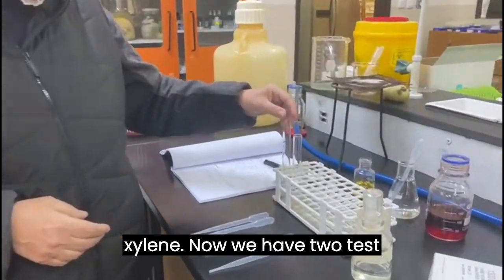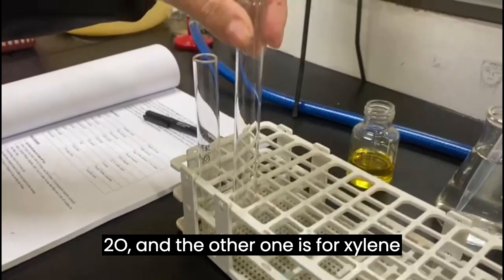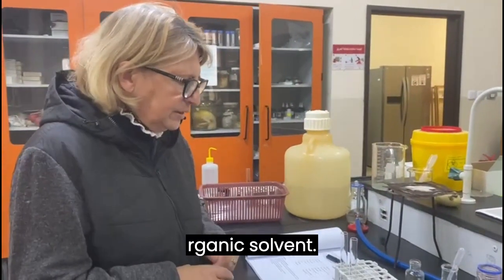Now we have two test tubes. One is for water, H2O, and the other one is for xylene. Xylene is a hydrophobic organic solvent.